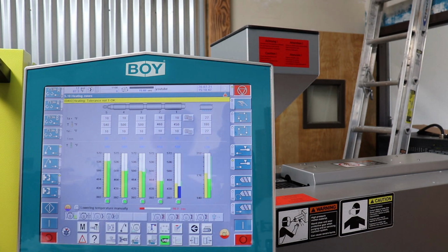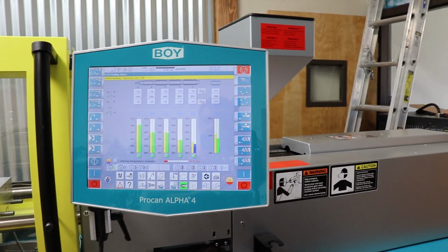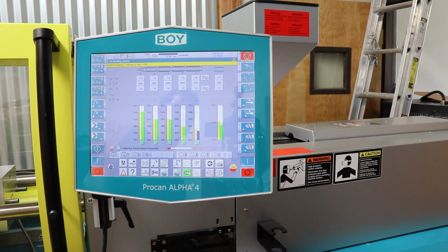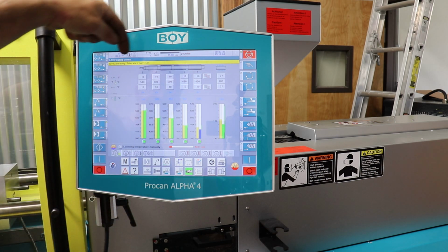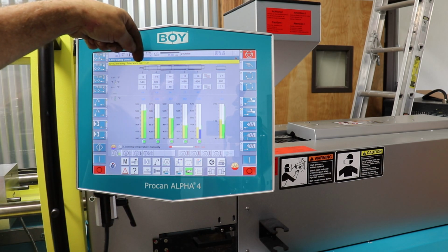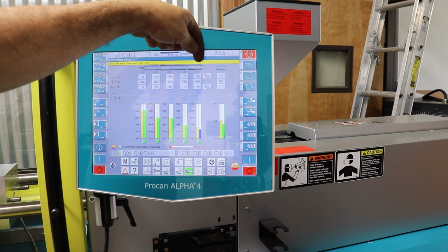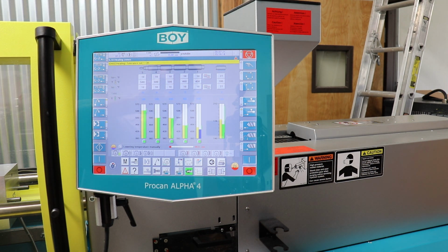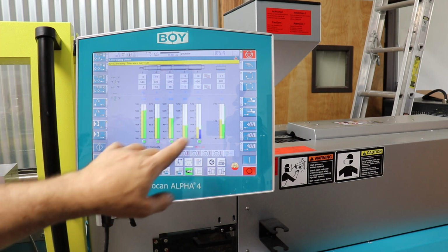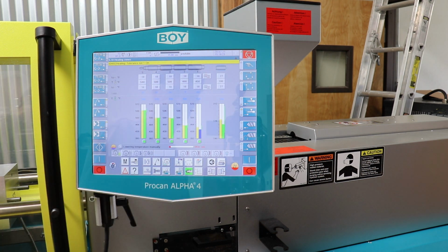And then here on the controller, you can see we're on the temperature page right now. So as soon as this little timer bar goes away and this blue bar turns green, which indicates the different heater zones. So here's the nozzle. This is the leading edge where the hot plastic squirts out. It's usually the hottest spot. And then this is the first heater bank, and there's several heater banks in that injection unit that I showed you earlier. So as soon as this heats up, we are good. And then over here is a water cooling jacket. So there's also water that keeps the back of the nozzle cold so that the plastic doesn't start melting in the hopper.